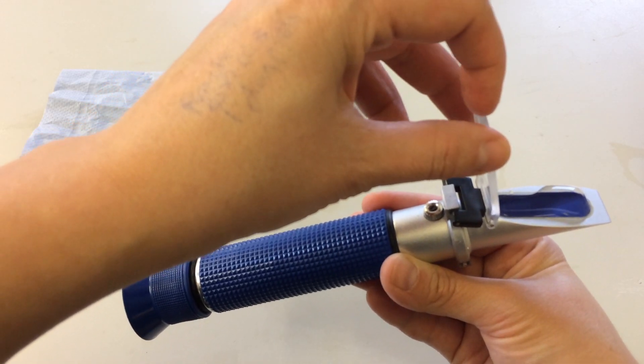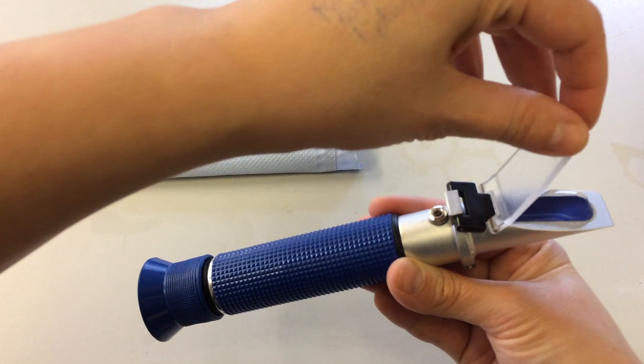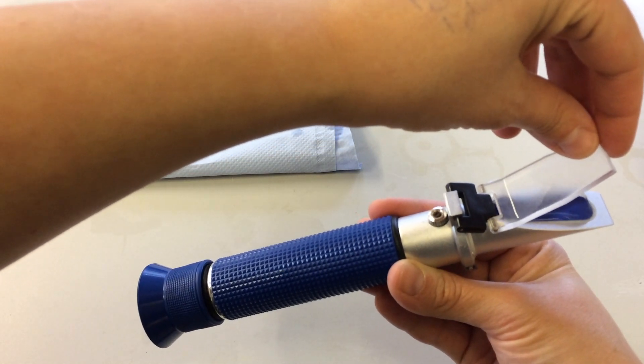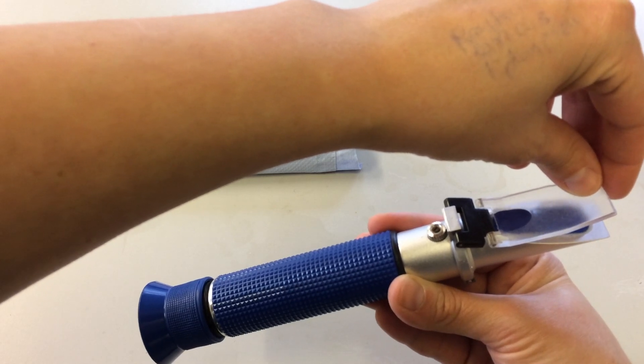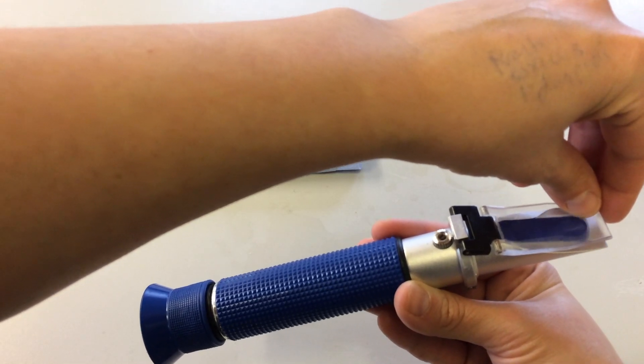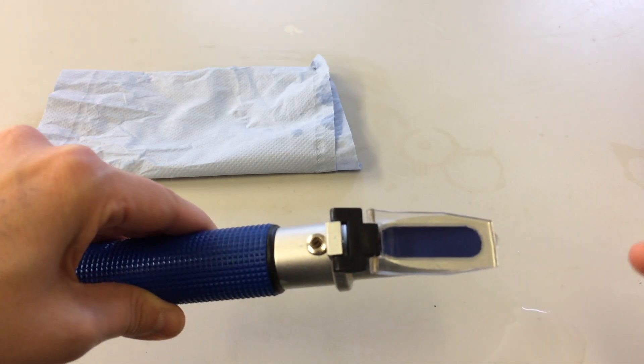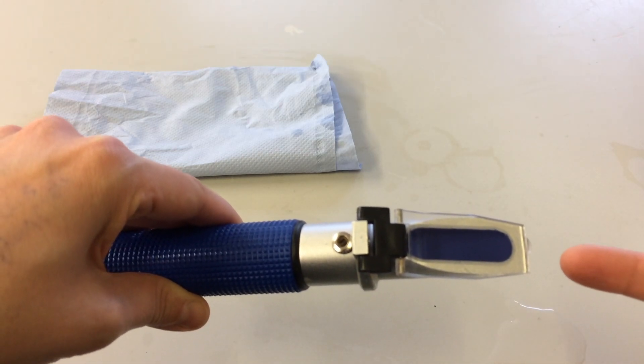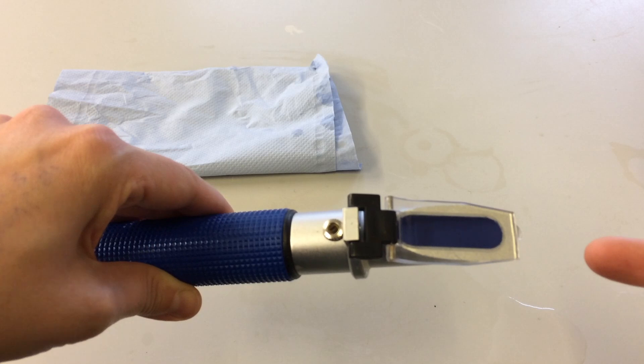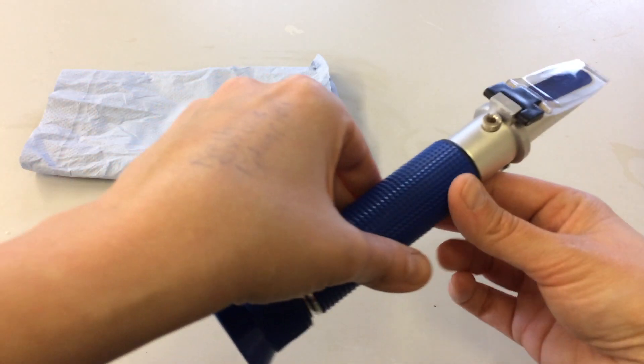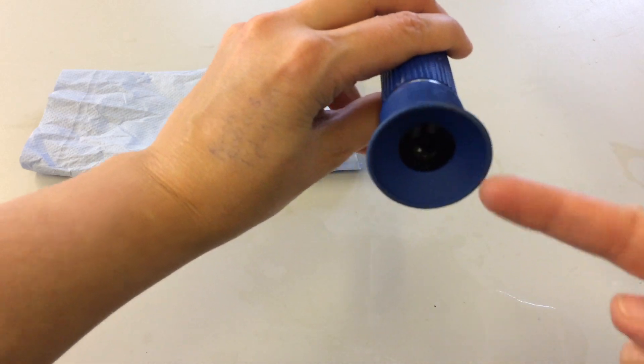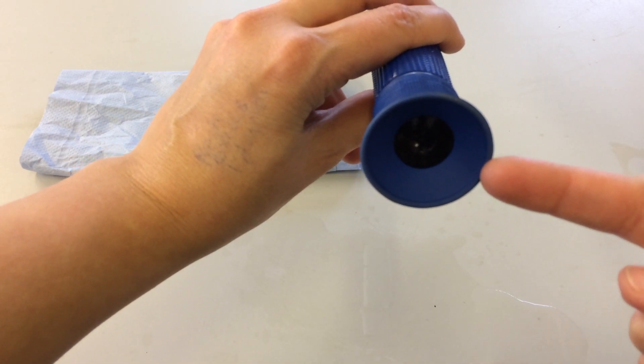What I suggest you do is gradually squeeze that seawater onto the first section of that cover plate like here, and then it'll push out and we don't get any air bubbles. If you see any air bubbles, just dry it off and repeat. There's nothing like a bit of practice to get a technique going. After we've done that, we then look through the eyepiece section.